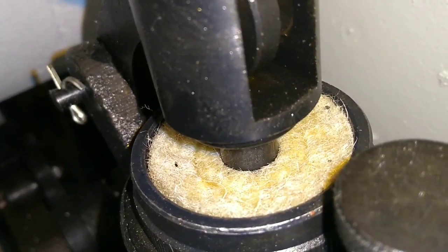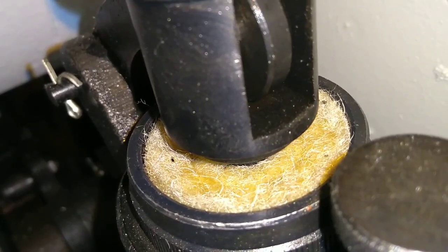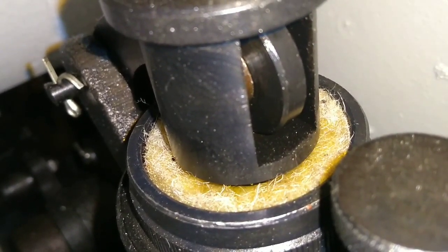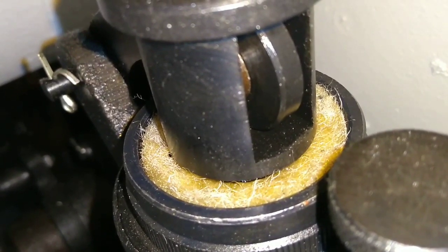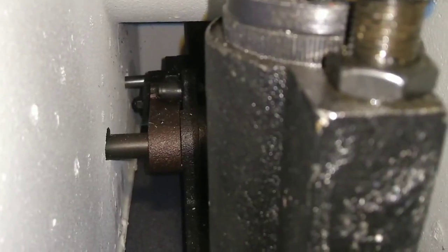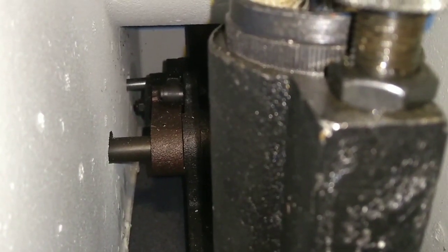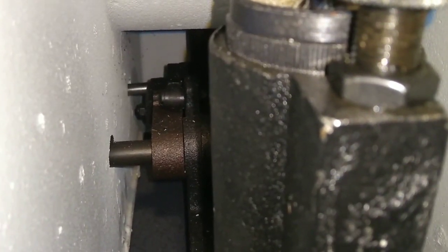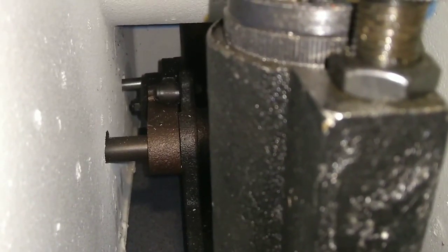Let's go ahead and load and check the time again. One-one-thousand, two-one-thousand, three-one-thousand, four-one-thousand, five-one-thousand, six-one-thousand. There we go. It looks like the dashpot — we've got enough oil in there, we've gotten all the air out of the system. Not all Rockwell testers are set up like this. This is just for an HR-150A, which is probably the most popular, most copied model out of the Chinese models.